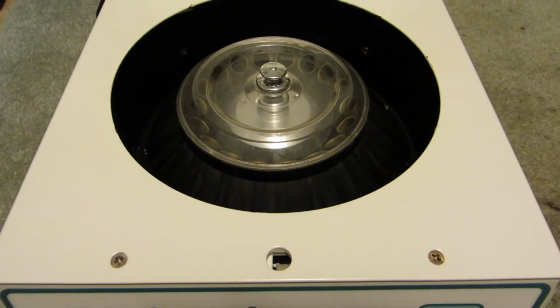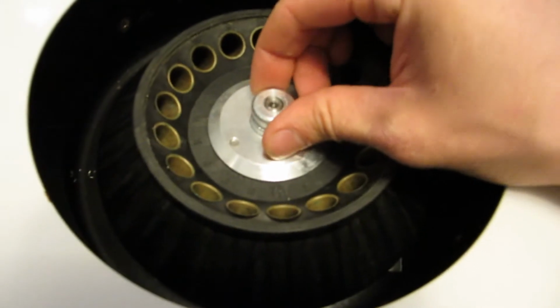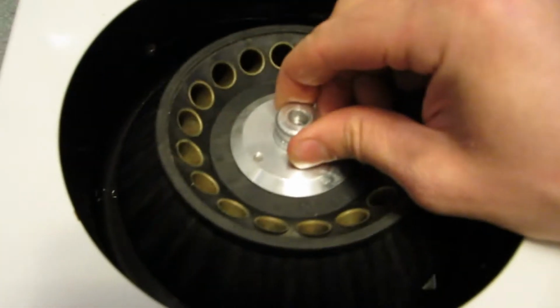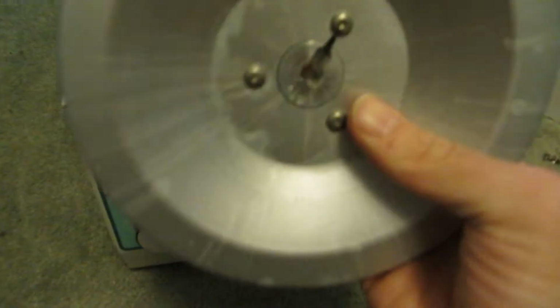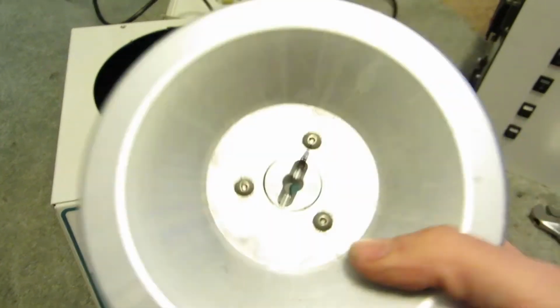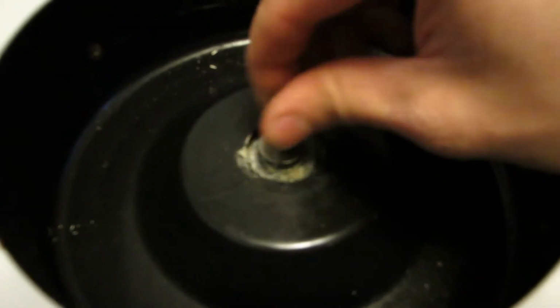our centrifuge. Alright, I got all the screws removed, I think. And the set screw that holds this part on. So you can see, this is quite a solid piece here. It's aluminum underneath. Fairly heavy. Maybe 3/4 of a pound. And underneath, get your motor shaft there. Let's open her up.